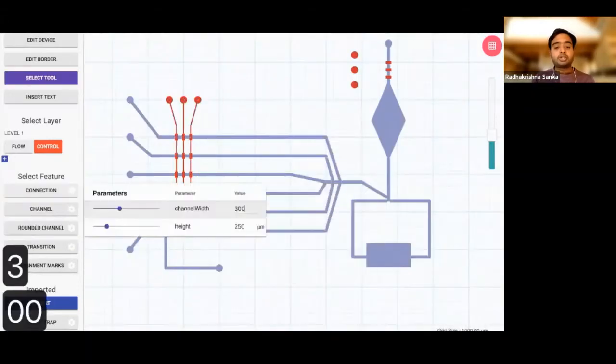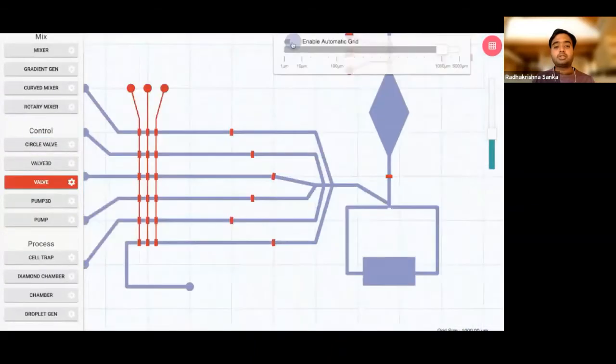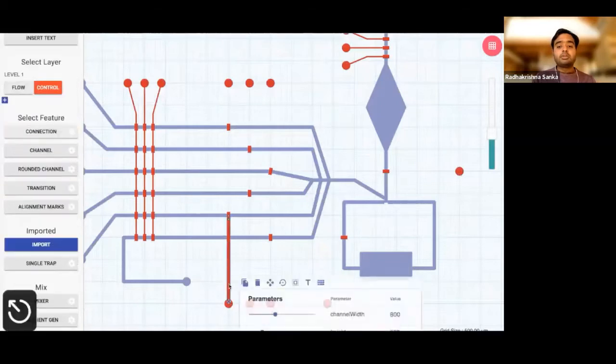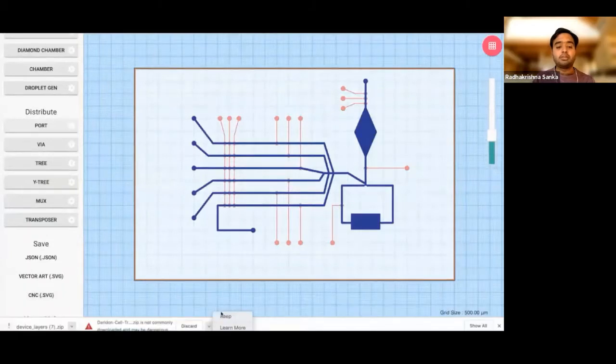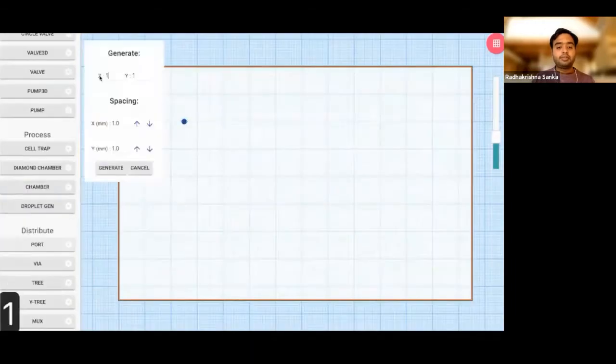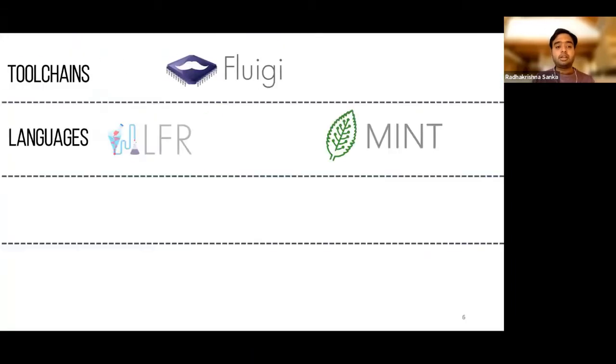But the most important part, as you can see, is the way we design this entire device. This is a screenshot of 3DuF, right? The way we design everything in 3DuF is that we think about everything to be parametric. We think about everything to be standardized components. And we put together standardized components in a parametric manner with parameters which we know how to modulate, and we know how they will behave at the end of the day when we modulate those parameters. That means you can actually standardize the entire device design, and there are a lot of benefits that come in. And it's not just that using these components and standardization is helpful, but our lab at CIDAR thinks about tool chains, right? We think about what we can do.